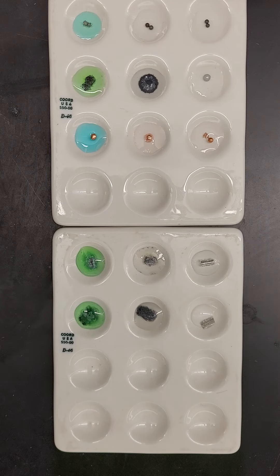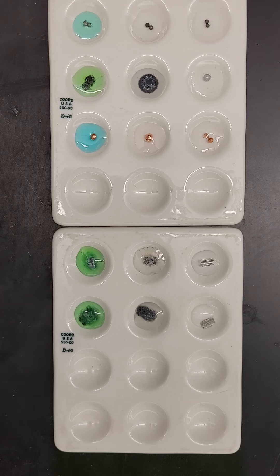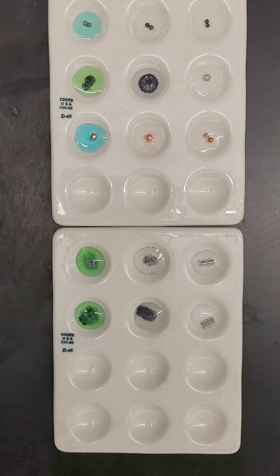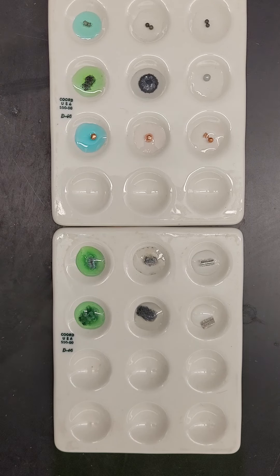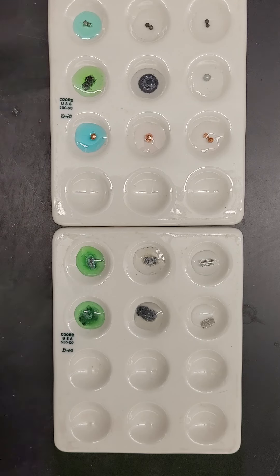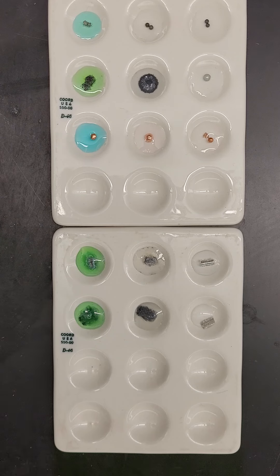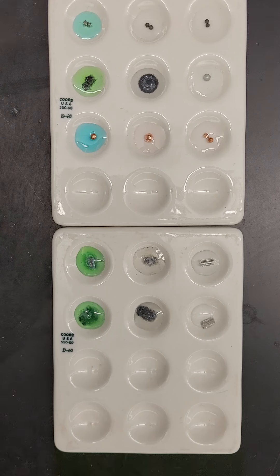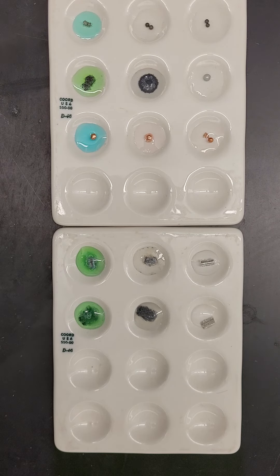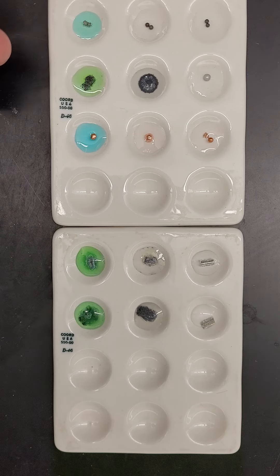The second column is the one with zinc. The first row looks the same. The second row with lead nitrate looks completely different from what it started — it's not only a different color, it kind of broke apart and spread out across the base of the well plate. Similarly, the third row shows quite a big noticeable change with bubble formation and even a change in color of the solution.